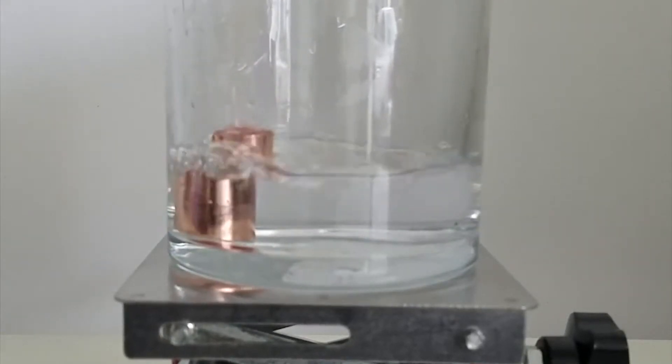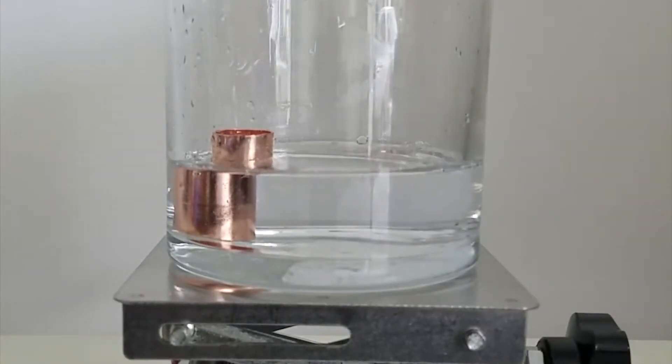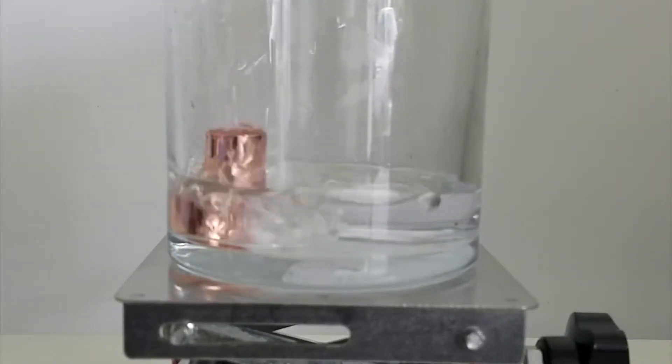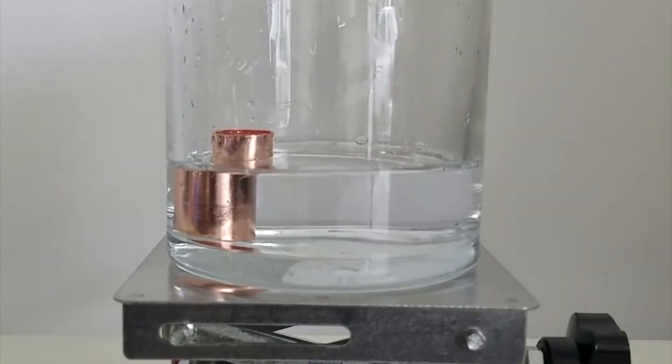I intend to be evaporating it away and obtaining the solid copper chloride. After adding the pipe, I added about 200 milliliters of hydrogen peroxide. If I was trying to create an exact solution, I would have measured more accurately, but I intend to evaporate it away at the end, so I didn't care too much about exact measurements.